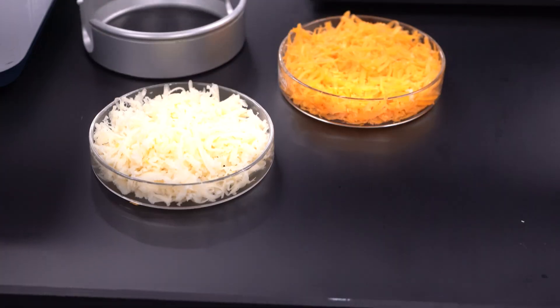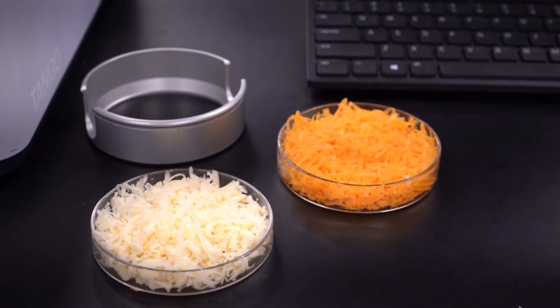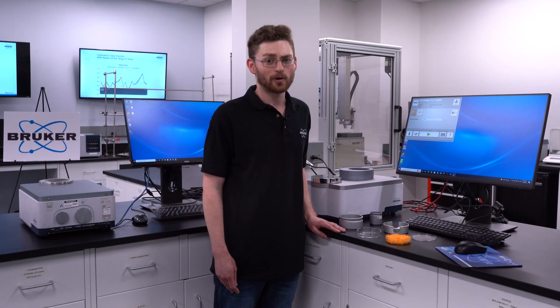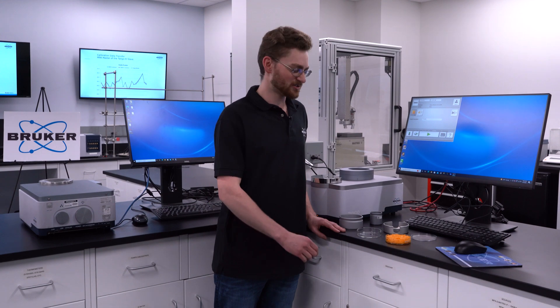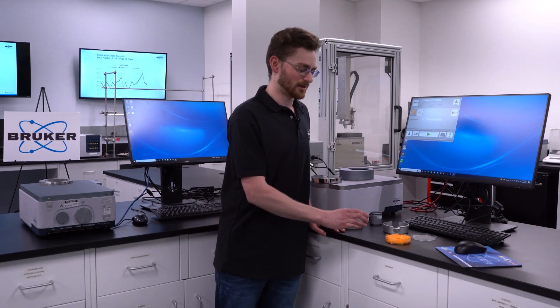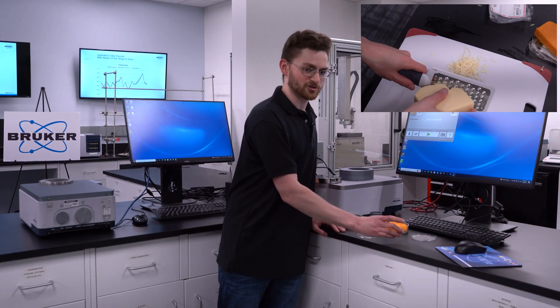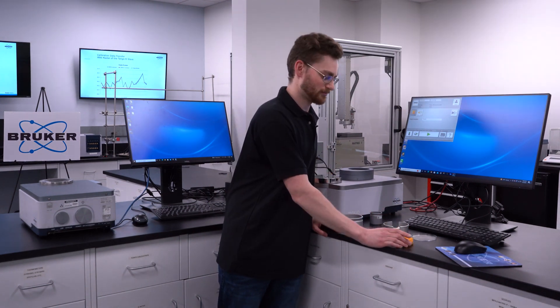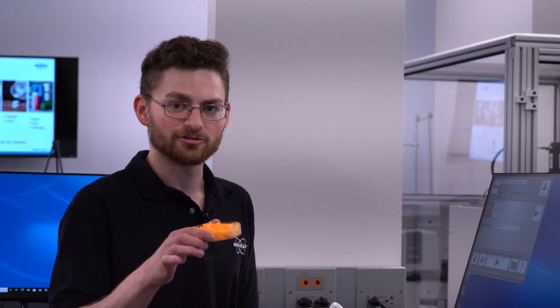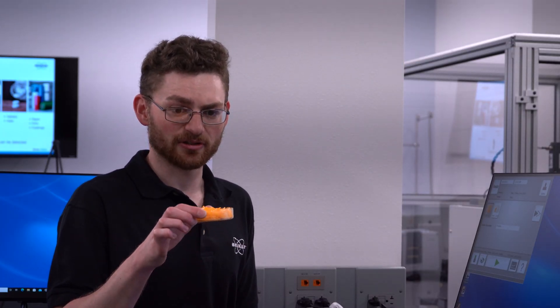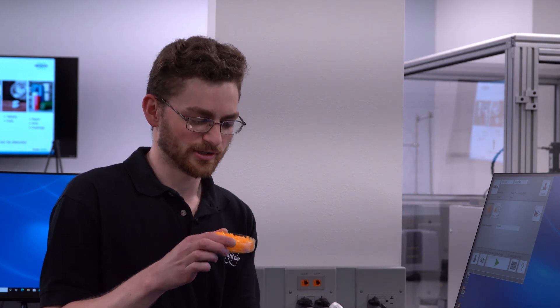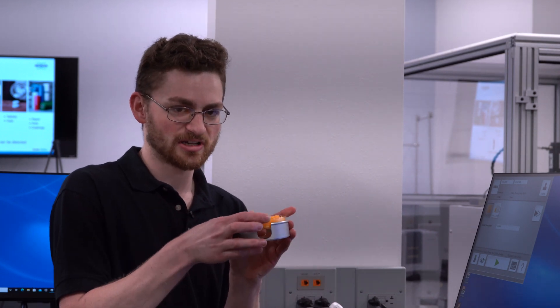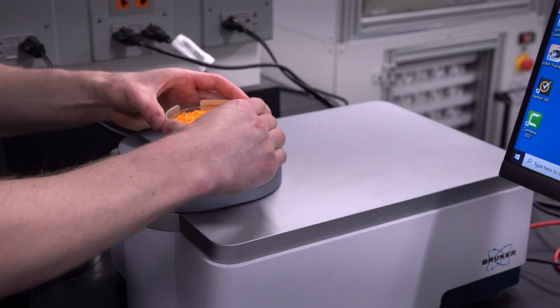Today we'll be using our out of the box calibrations to measure two types of cheeses. These calibrations required no adjustments and to use them you just need a petri dish and a shredded sample. After you've filled your petri dish with your shredded sample so that there's little to no light showing, simply put it into the adapter and into the rotator.